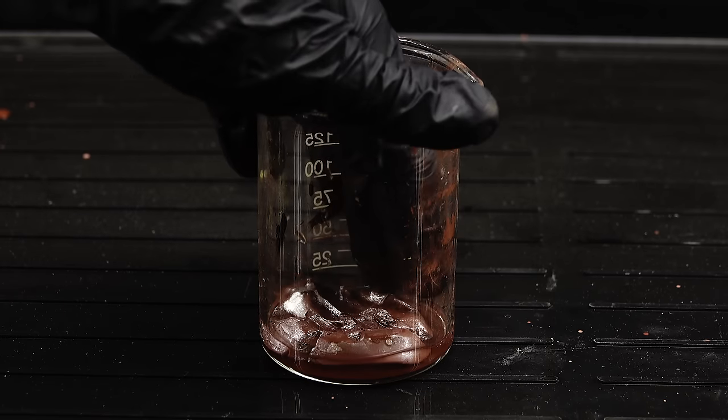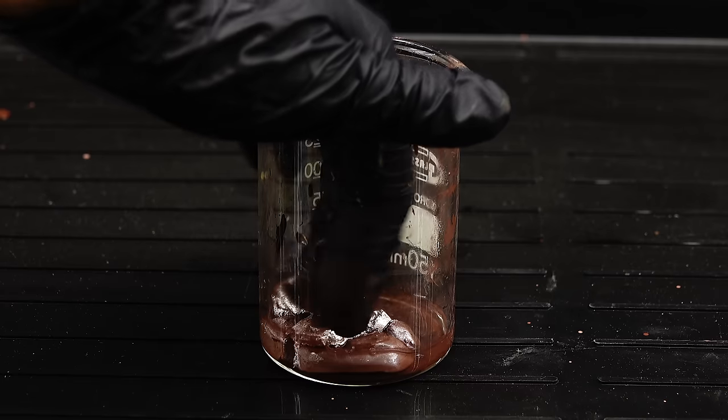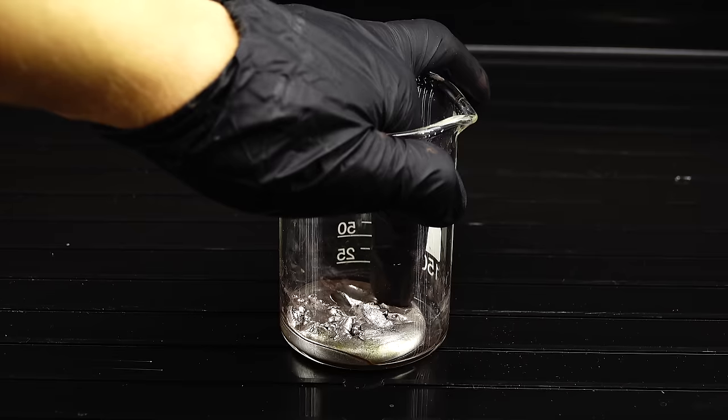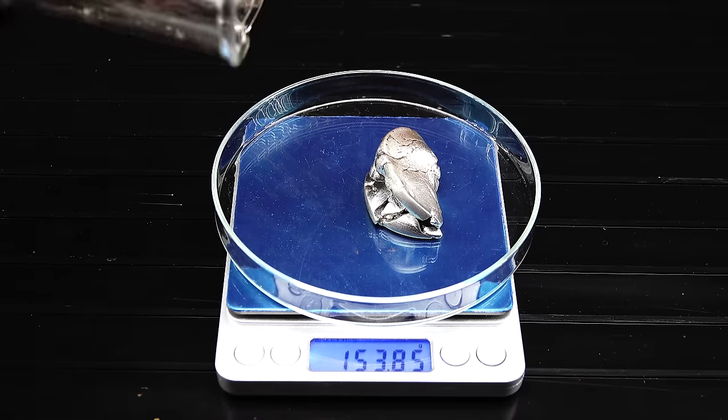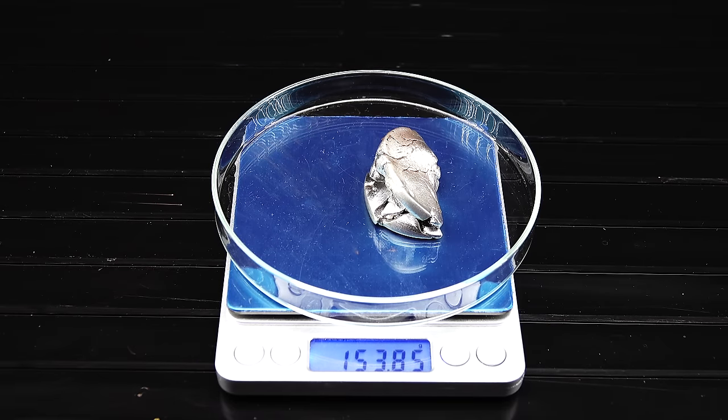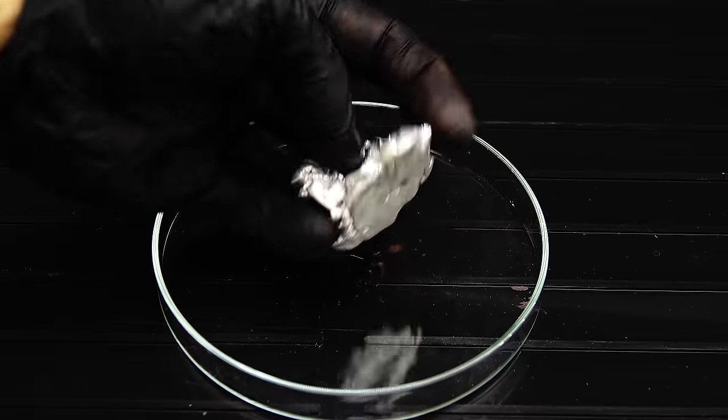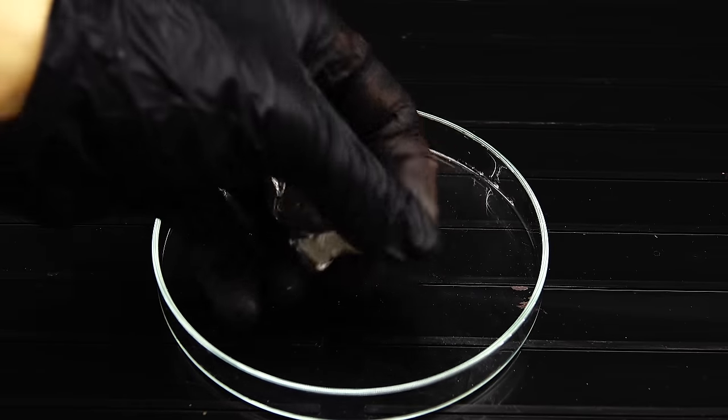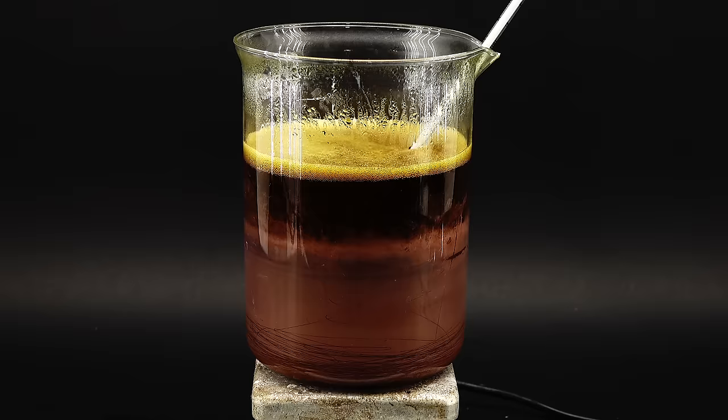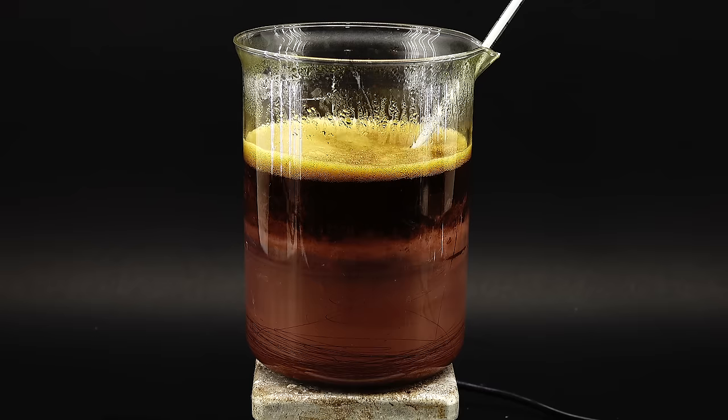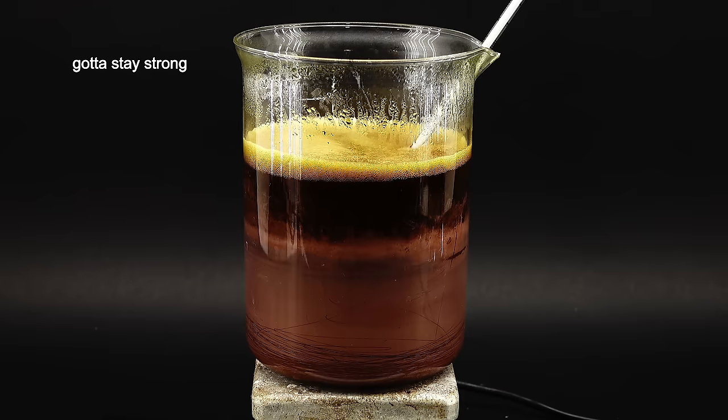After a few washes, the beautiful shine of my product started becoming more and more apparent, and its texture was exactly what I hoped it would be. I washed it a few more times since there was still a ton of undissolved copper powder inside it. I then weighed it, and it turned out that the roughly 110 grams of mercury I added absorbed only about 40 grams of the copper powder. I was really intrigued by this since I thought that all this mercury would be able to easily absorb most of the copper, and the amalgam's texture was surprisingly tough for how little copper it managed to absorb. This also means that I could have done just a single run of the copper powder procedure instead of 8, but I will just call that a learning curve and not break down and cry, which would be quite an appropriate response to pouring a week of your work into the waste container.